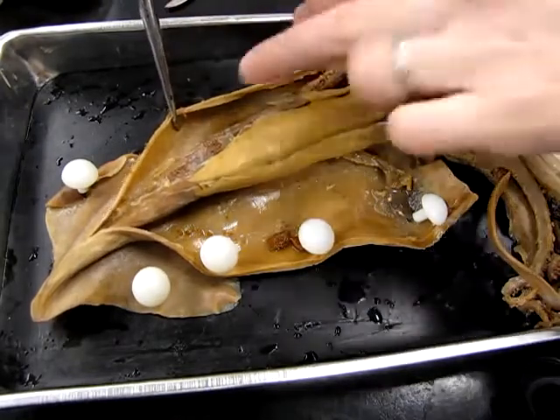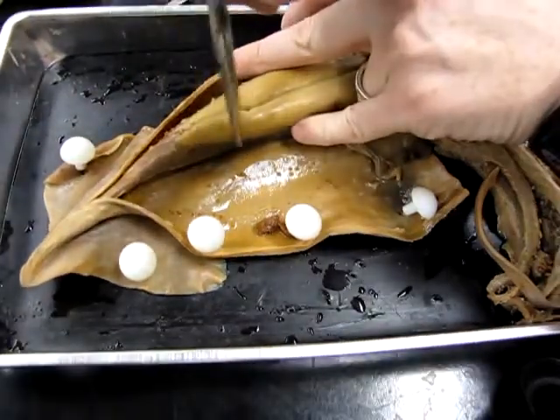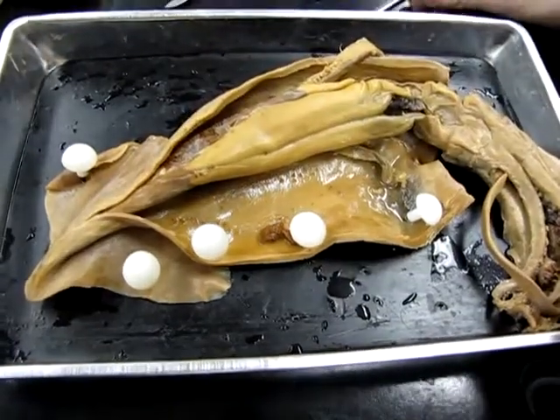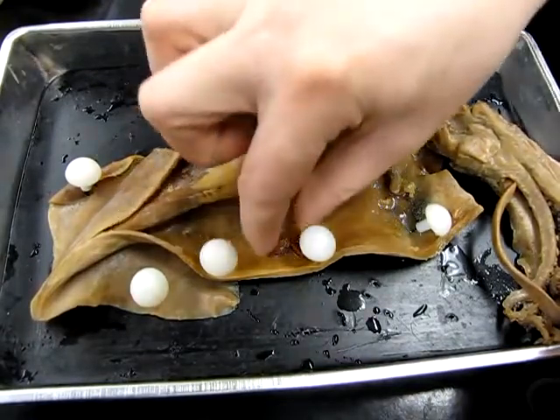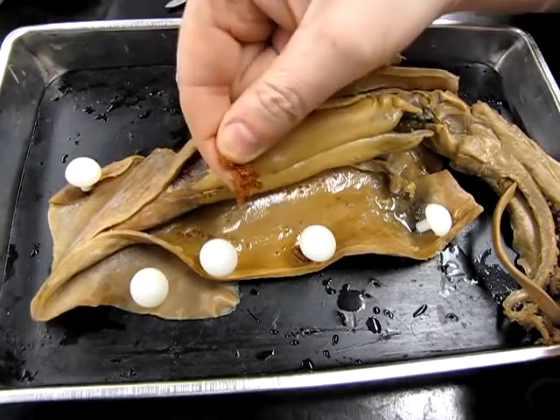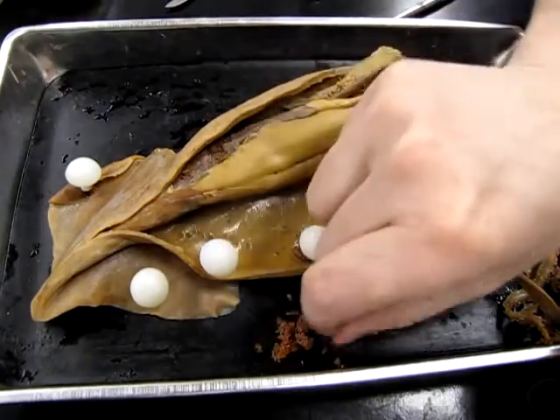We also see this large reddish mass all through here. Up here we can see it underneath as well. This is the ovary. There's one very large ovary in the female, and you can see here the peritoneum has ripped away a little bit, and it's exposed some of the eggs in there. Here's a few eggs from another female, so you can see what that looks like inside. So that's the ovary, the site of egg production.